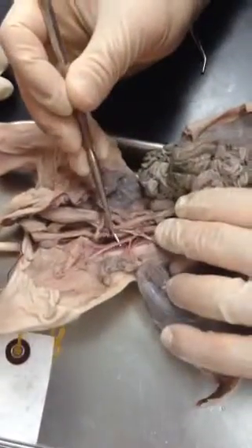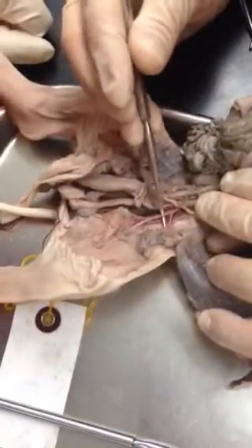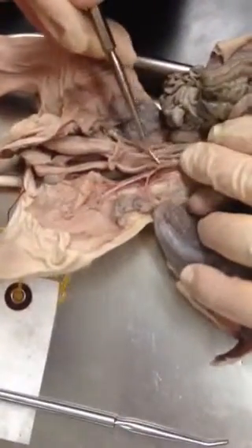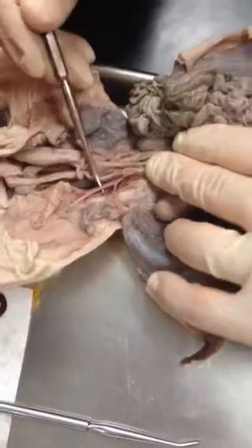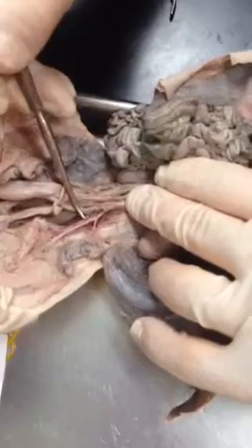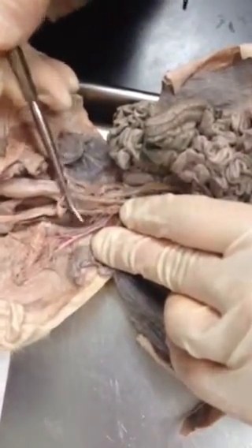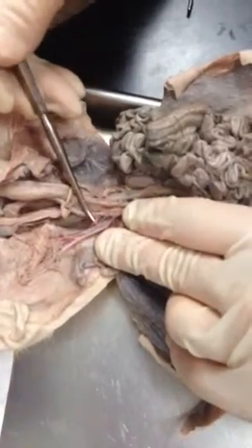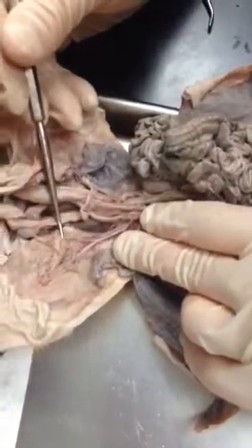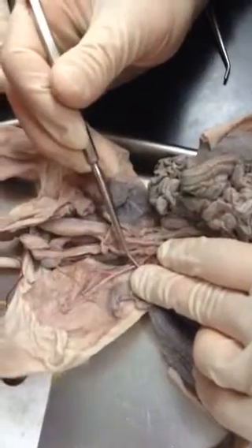Postcava. And this is where it gets a little different and confusing, because the arteries and veins are different in the legs. Coming off the descending aorta is the external iliac, and further down is the internal iliac arteries. The first major branch off the external iliac is the deep femoral artery, and then the femoral artery.